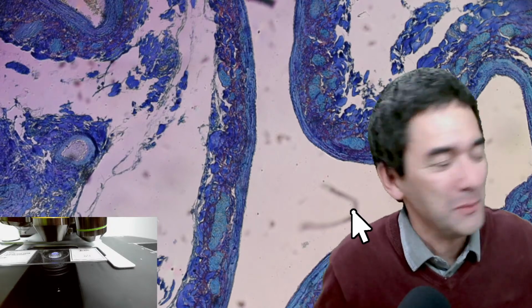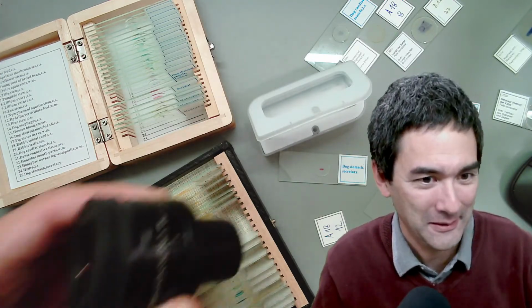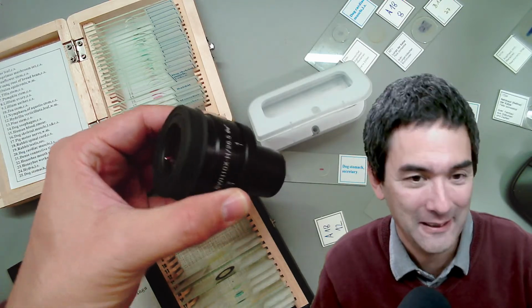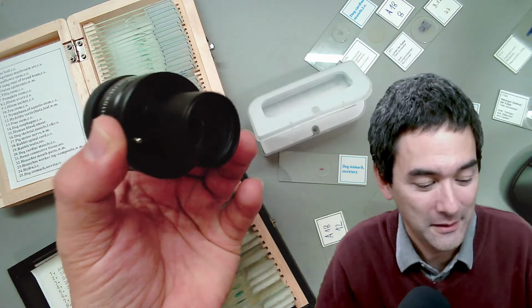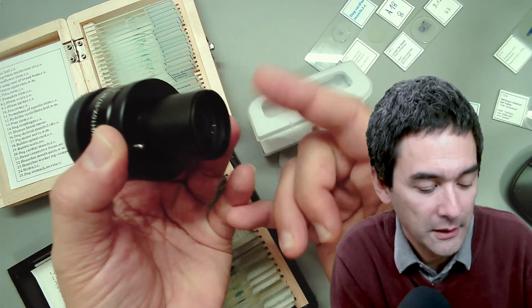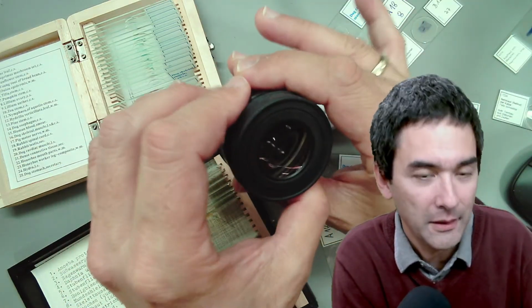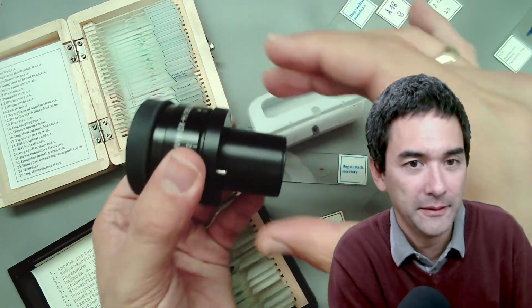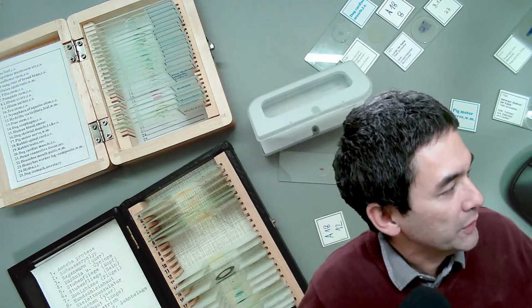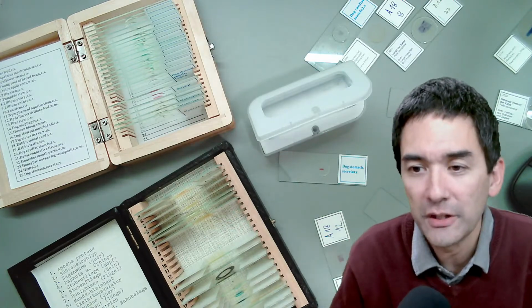But you know what, I'm just going to show you, because you were asking about the eyepieces. Look, I'm going to pull it out. I'm going to show you how the eyepiece looks. I'm almost scared a little bit. This is how the eyepiece looks, okay? That's pretty massive, and the diameter is much larger than the standard diameter. So when you look through it, it's very nice. I would say this is one of the reasons why you get such a nice impression.